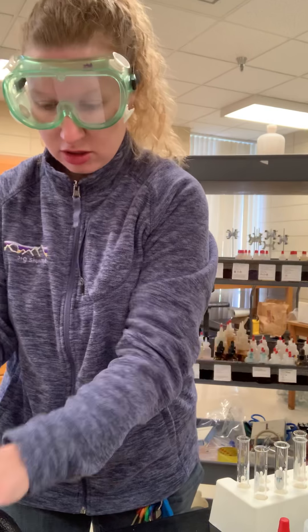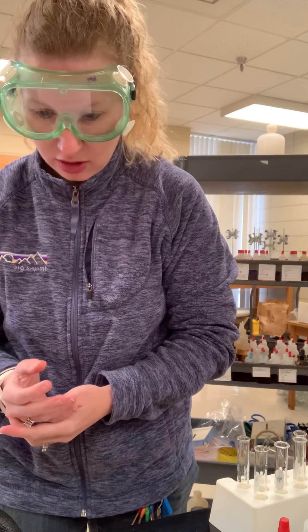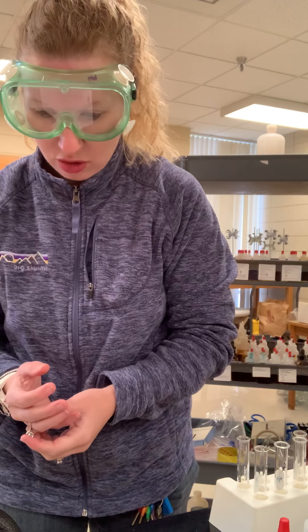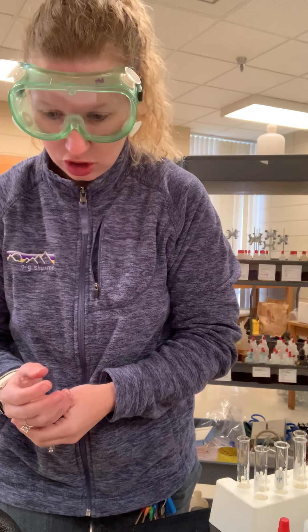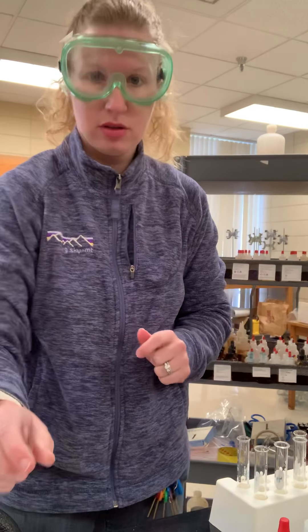So now we're all set up and we are ready to go. We've got this set up, so now we're going to proceed.